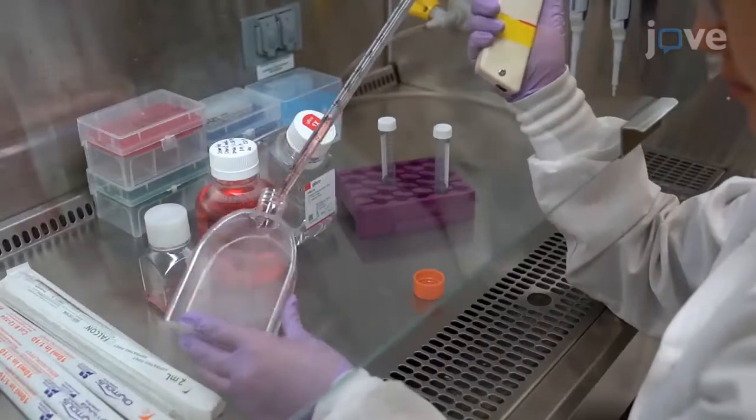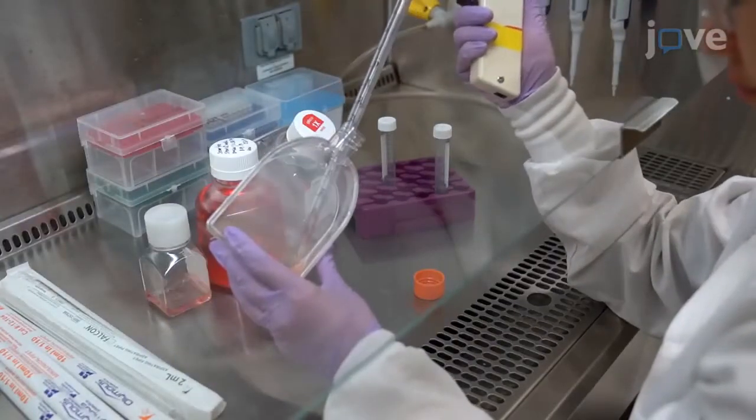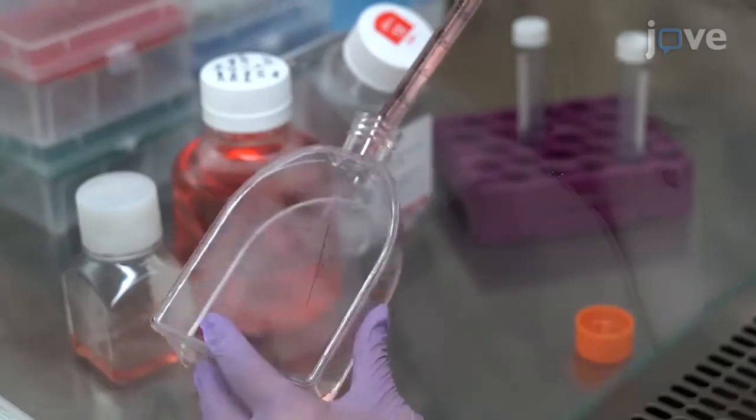After this, pipette 8ml of serum-free cell medium into the flask and pipette up and down 3 times to mix.